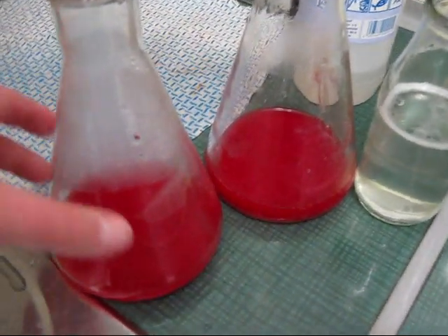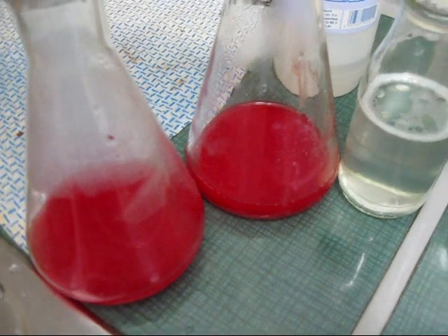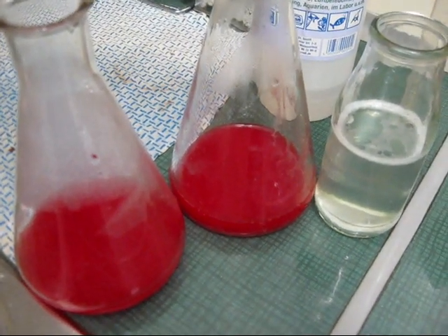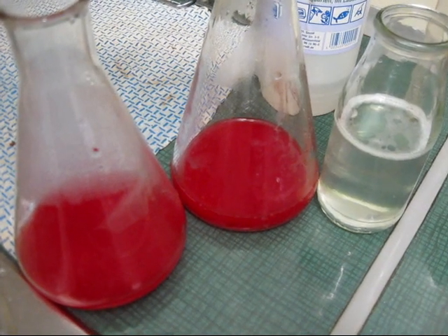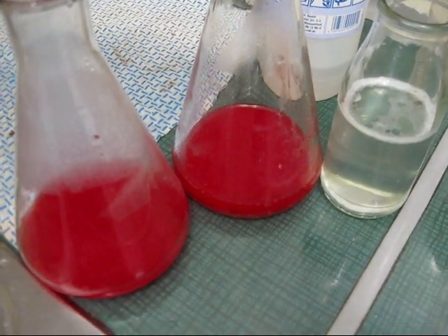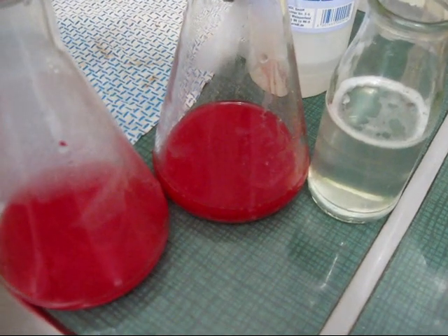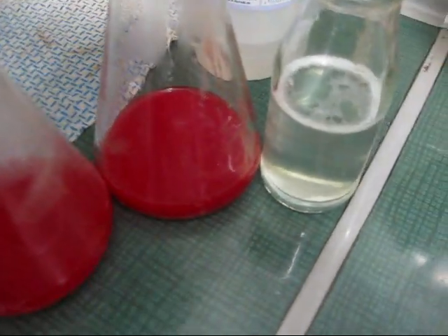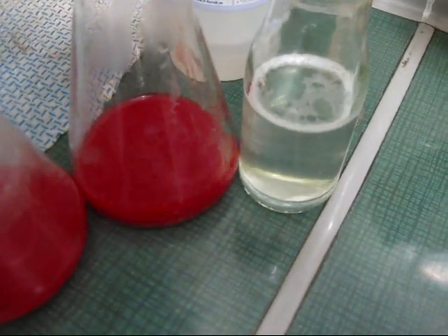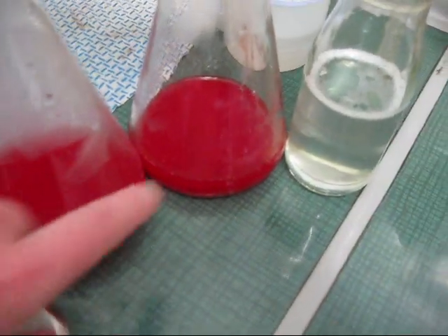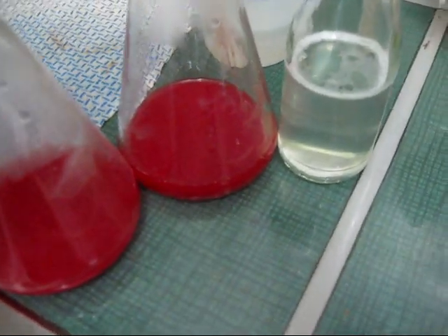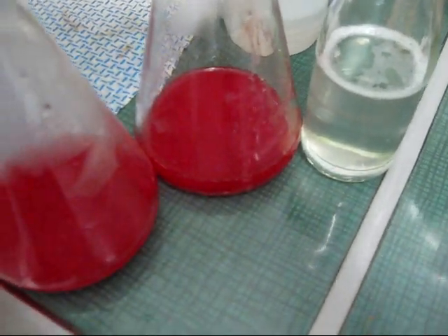Okay, so in the next step I cooled down the beakers again with ice cold water, because the heat accelerates the release of DNA, but also it accelerates the destruction of DNA by denaturation. So now I will put these solutions, which I increased to the equal amount of water by the way, because now the release of DNA should be done. And now I will filter myself.